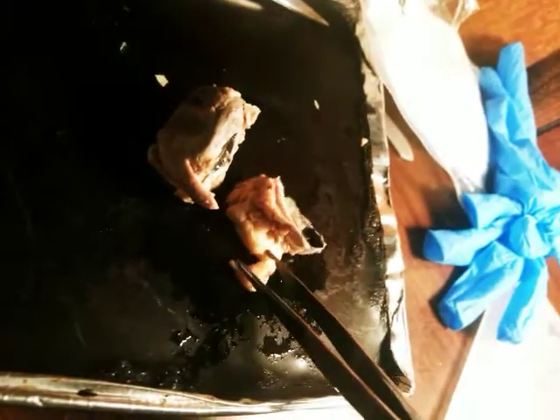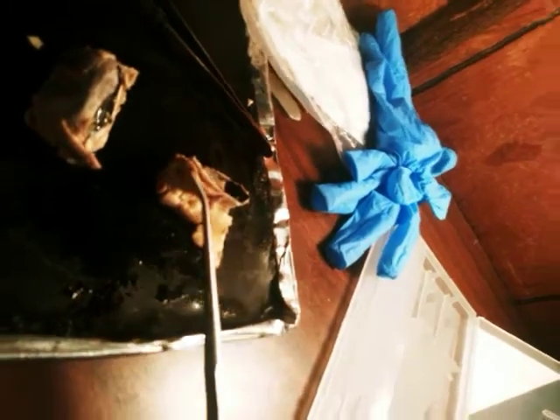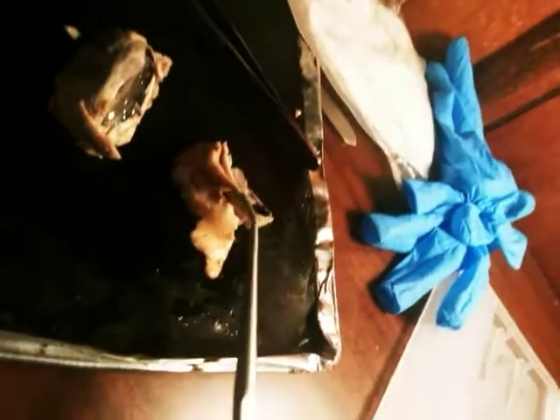In the back of the eyeball here, on the bottom, back, we've got the sclera. Where's my pointer? This is better. Okay, this is the sclera. Back here connected to the optic nerve, in the back where all the veins are collected, is the retina.